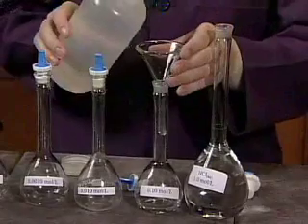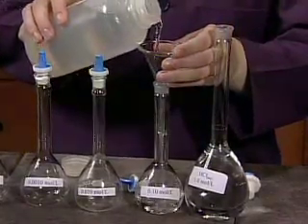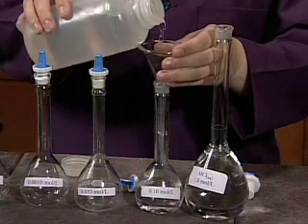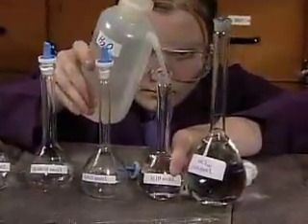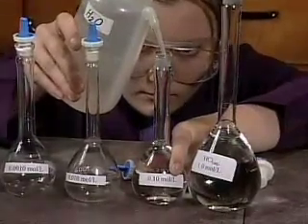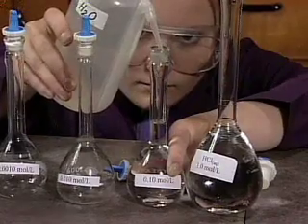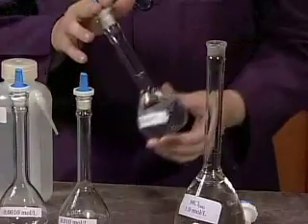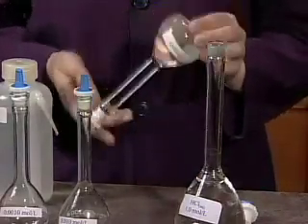Deionized water is added to fill the flask exactly to the 100 milliliter calibration line. The change in concentration is inversely proportional to the change in the solution's volume. If water is added to the 10 milliliters of 1.0 mole per liter hydrochloric acid in the flask until the final volume is 100 milliliters, the volume has increased 10 times and the concentration becomes 1/10 of its original.